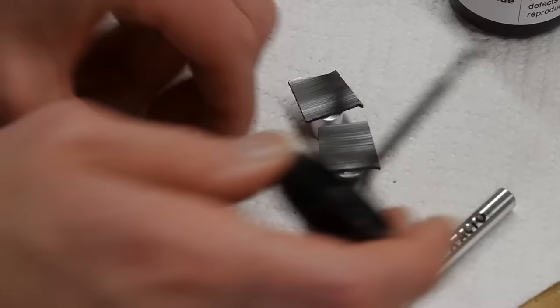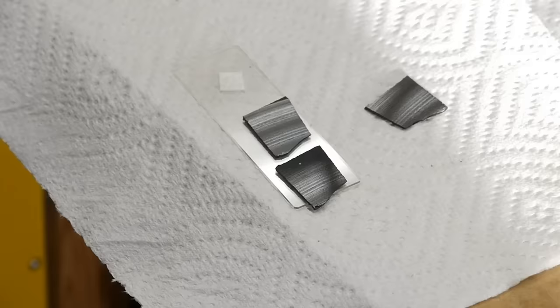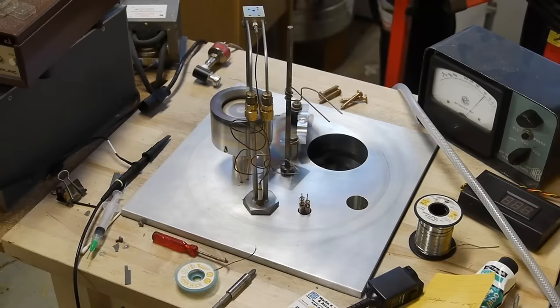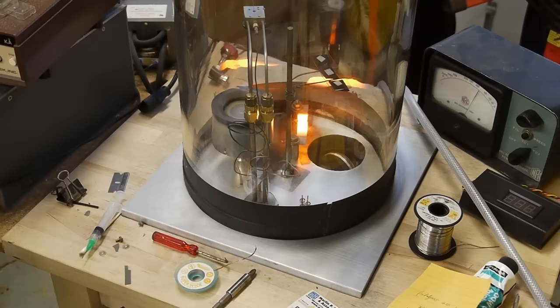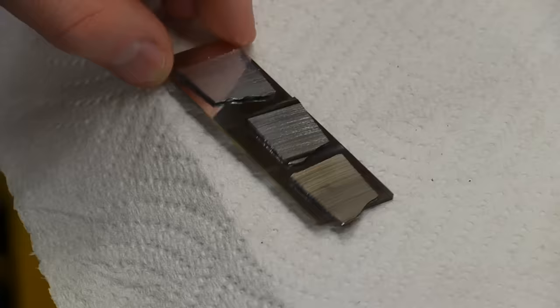So the way to solve this problem is to coat the object in something conductive. In this case I mounted the pieces of record to a glass microscope slide and then loaded the slide into a vacuum chamber and evaporated some silver metal onto the pieces of LP.